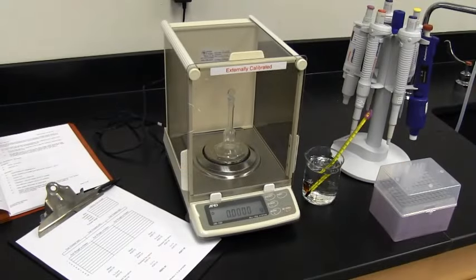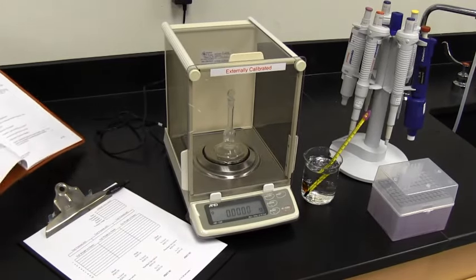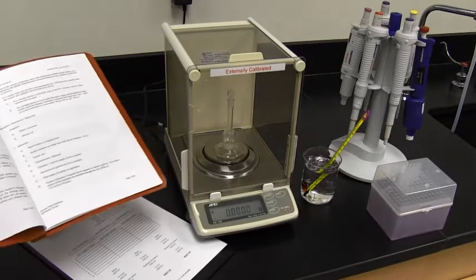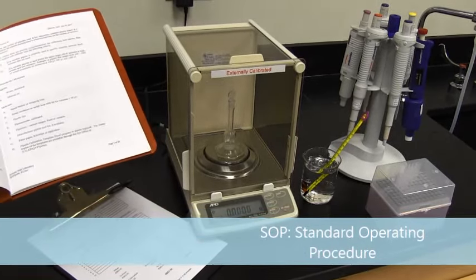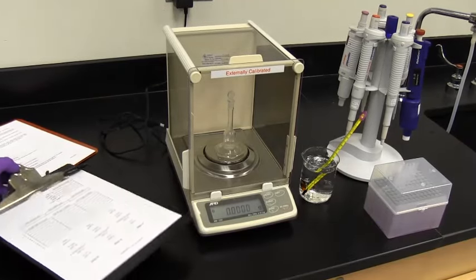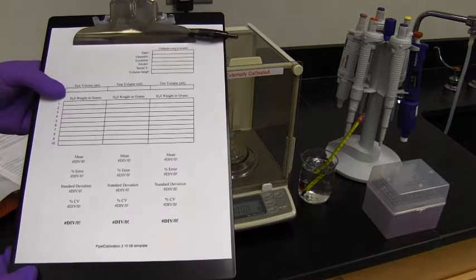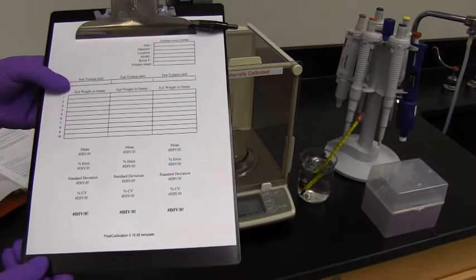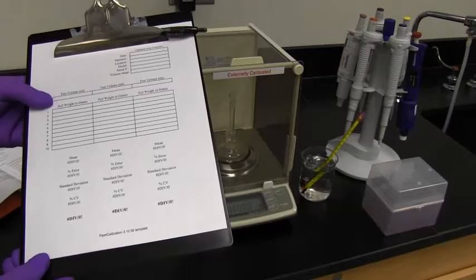In order to calibrate pipettes, you need several things. The first thing you need is a pipette calibration SOP. This is ours. Also, you need a form to write your documentation and results in. This is the way ours look. This is transferred to an Excel file that automatically calculates our values.